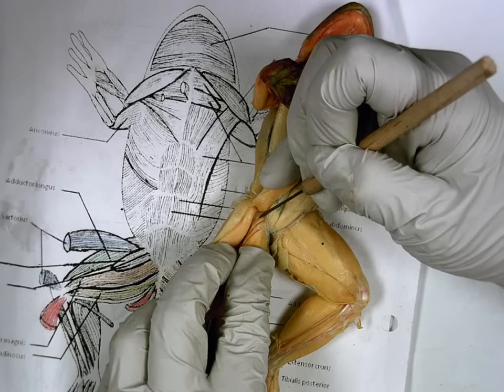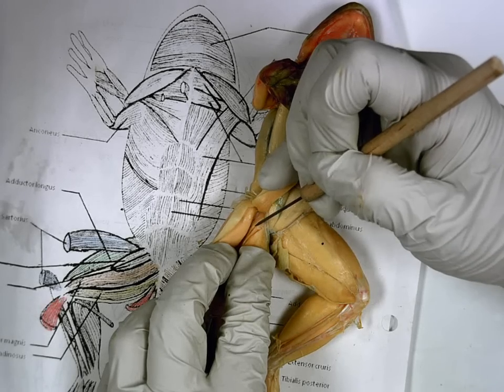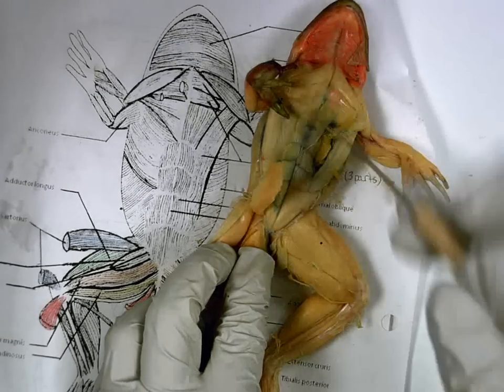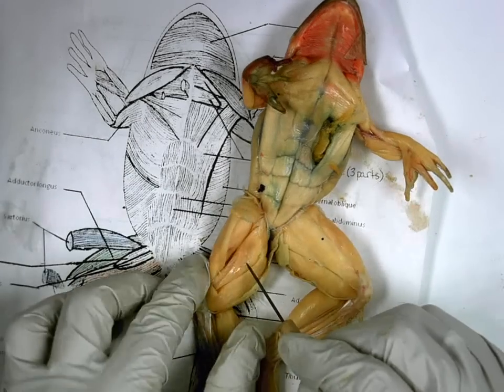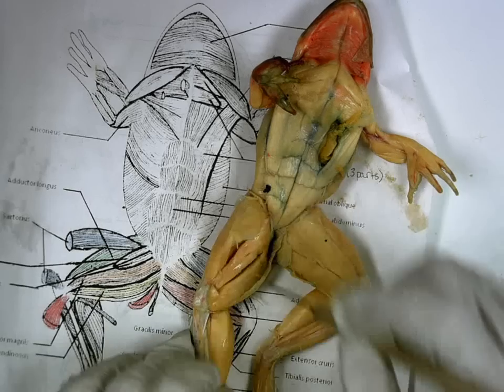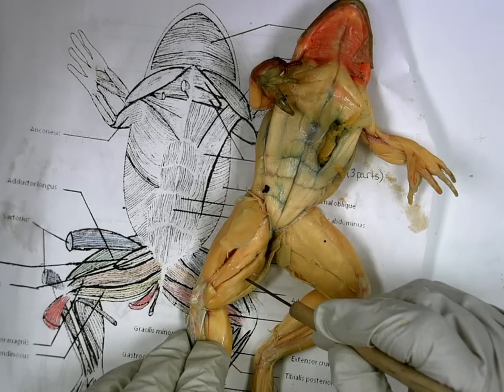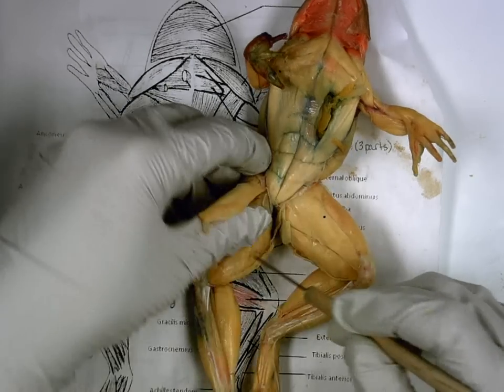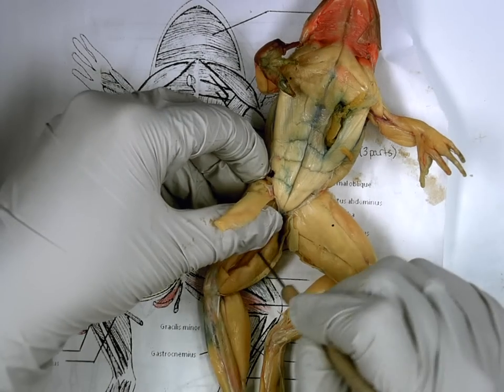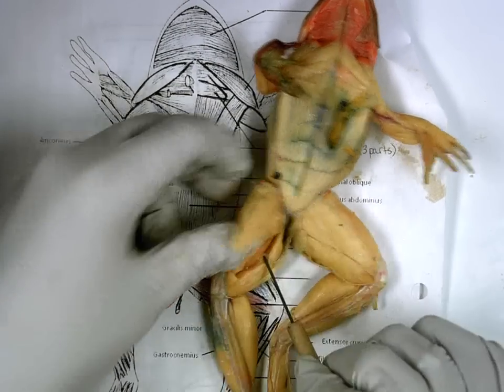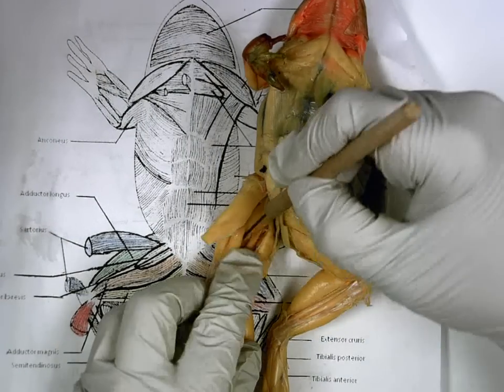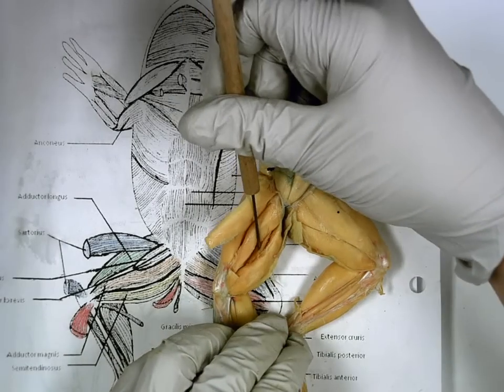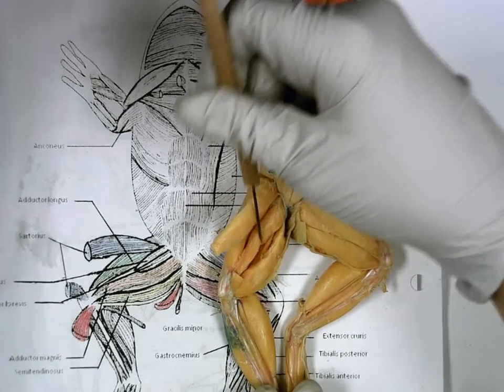Top one is pectineus. One below it is adductor brevis. Then we go down here between our adductor magnus and gracilis major. If I simply just pull them apart, I should see a thin muscle sitting right in between them. Who is this muscle right in between them? Semi-tendinosus. And that's it for belly muscles.